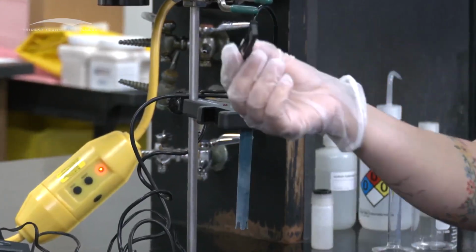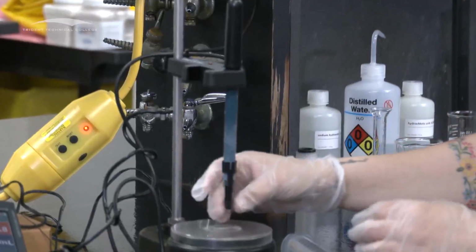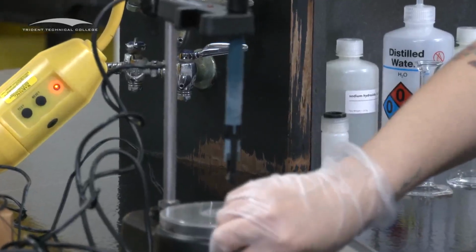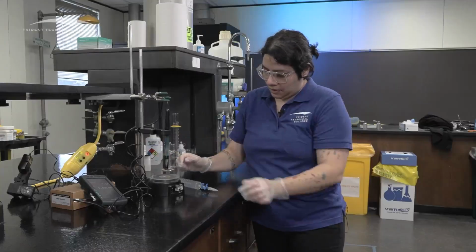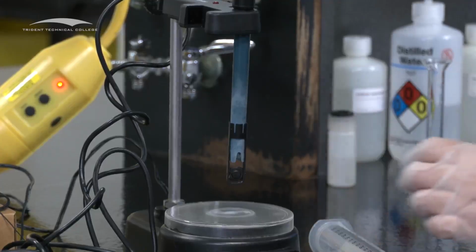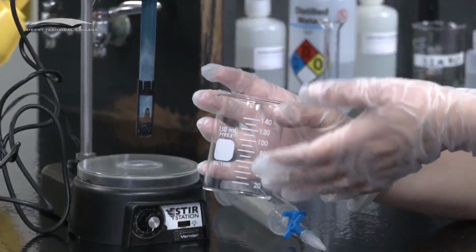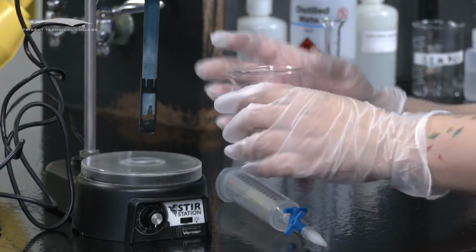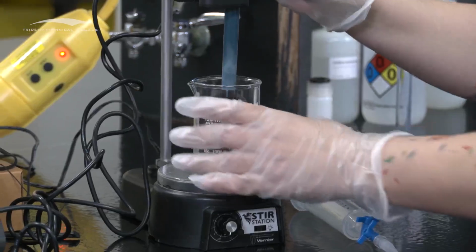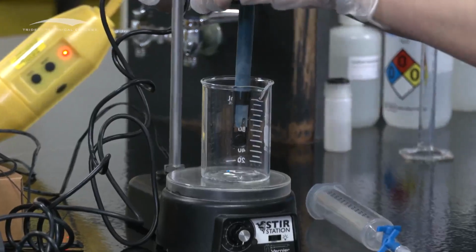Then you're gonna take this right here, which is your stir bar, and stick it to the bottom like so. When you decide the distance of it, make sure that you can stir without actually hitting the bottom of the pH probe. And then you're gonna take either a 150 ml beaker or a 250 ml beaker. The 150 is the best one to use if you are able to use it. If you notice, my stir bar is way too high, so we need to bring this down.